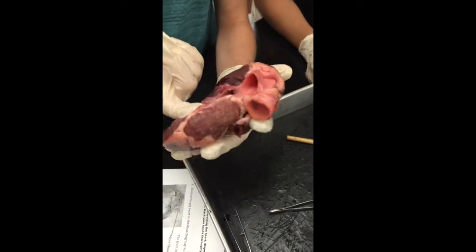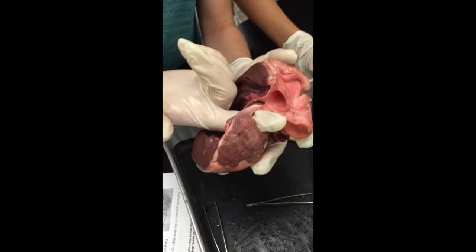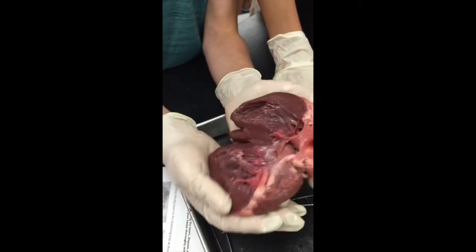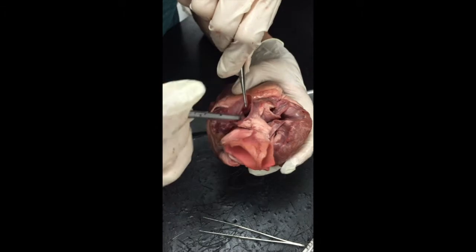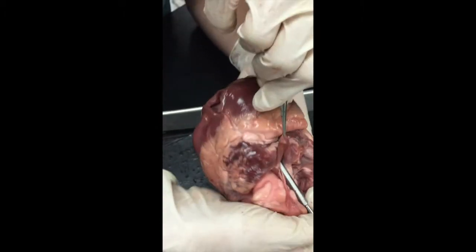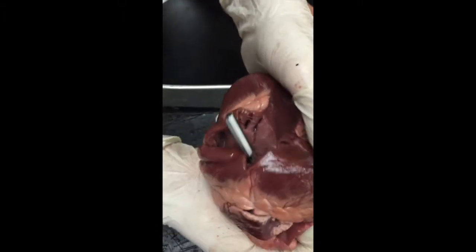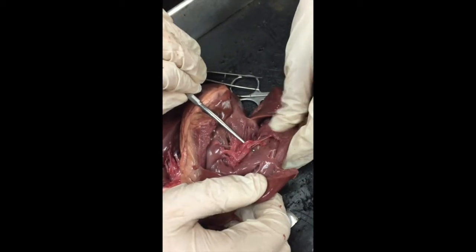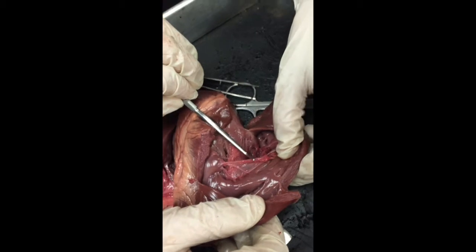Locate the pulmonary vein. Here, there's not much left of it, but here is the pulmonary vein. It is bringing oxygenated blood into the heart so it can be distributed around the body. This right here is the superior vena cava, and where it comes out in the right side of the heart, it is the inferior vena cava. This is the tricuspid valve and it prevents blood from flowing back.